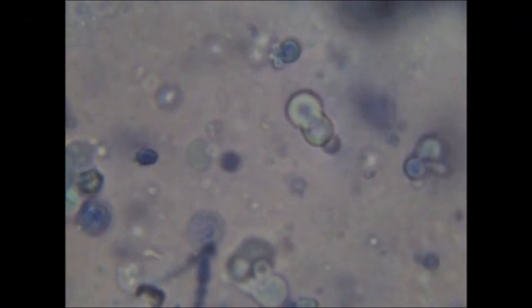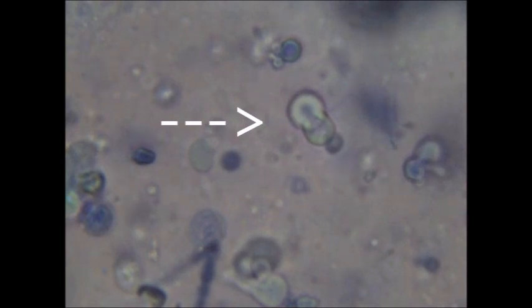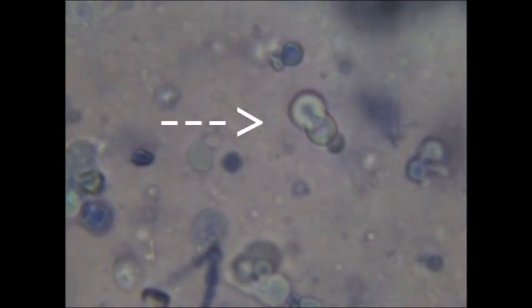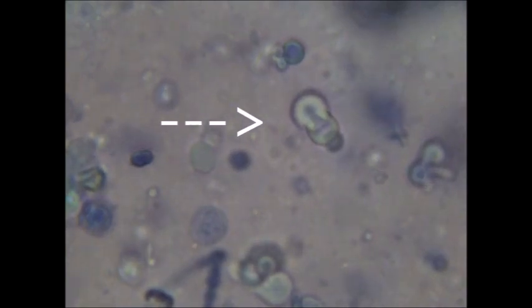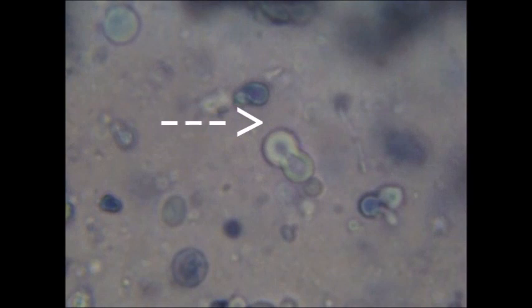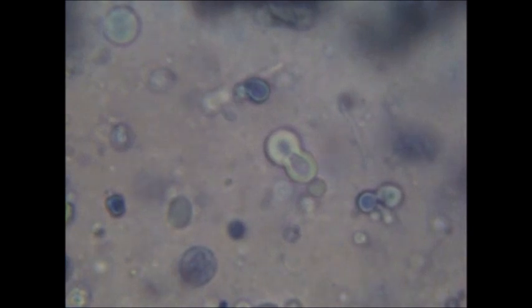Hello everyone. What you are looking at here is what I believe to be the process of vesicle division. This is a simple solution which I made by adding liquid lecithin to water and then adding several drops of methylene blue, a staining agent, and looking at the result under the microscope magnified a thousand times.